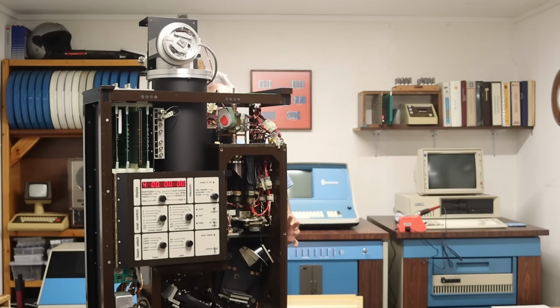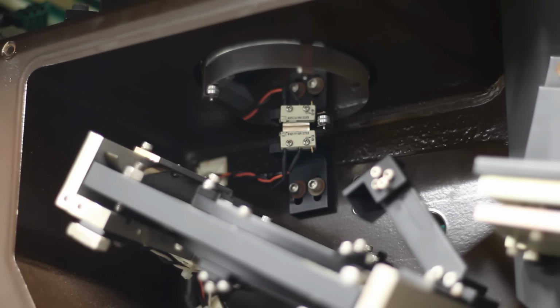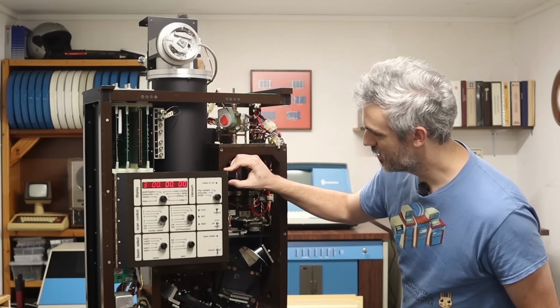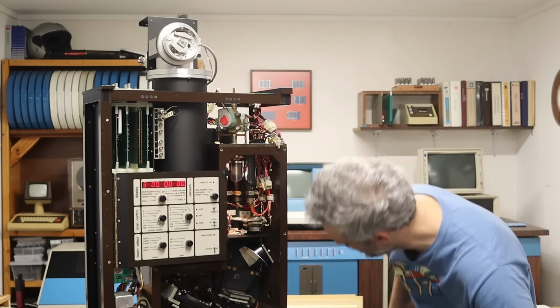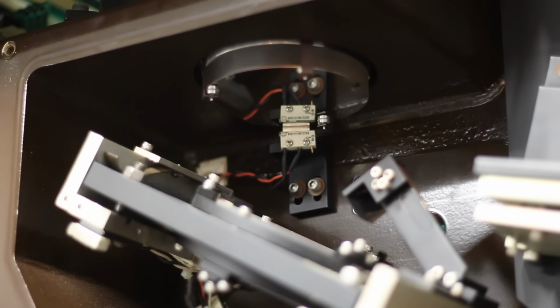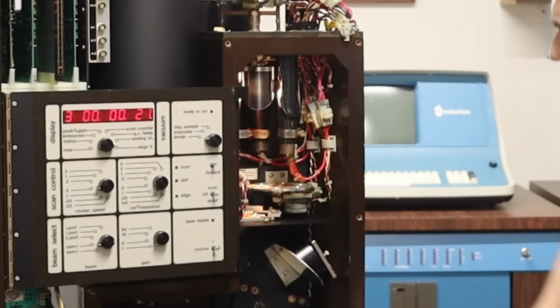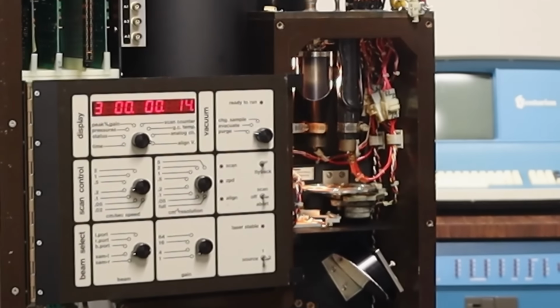Okay, things are turning on, making noises. The mirror is not moving. All right, let's flip some switches here, see if we can get it to do something. So we'll flip over to mode 3. The light came on, the laser came on, but our mirror is still not moving. And also we have some alignment voltages going on here that I feel like we didn't used to have before. That's interesting.